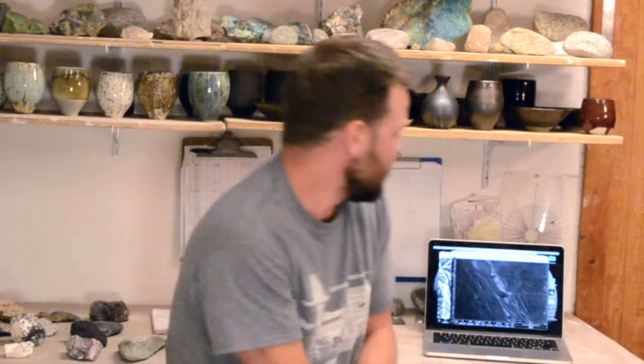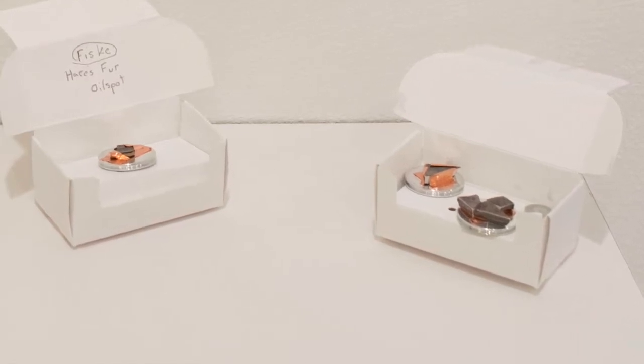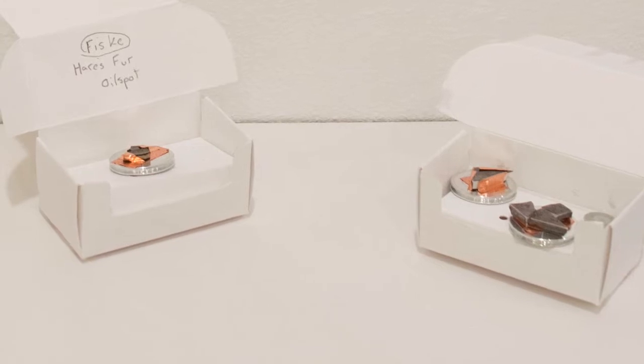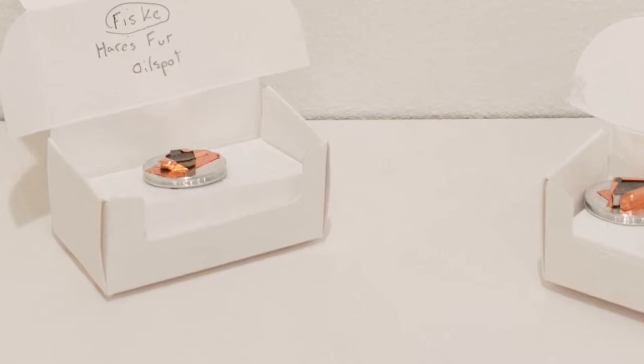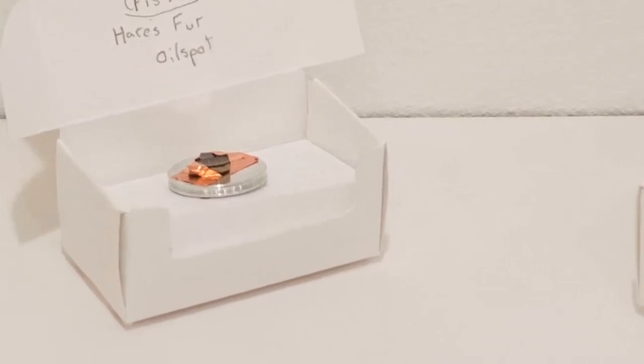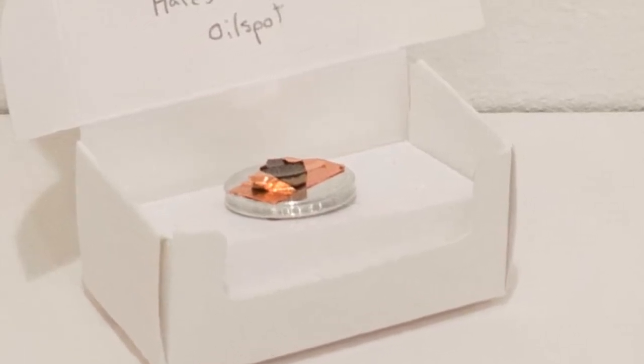With the samples that I was using, initially I had no idea what I was doing, and so I was just taking over broken chunks of glaze because we were really worried that having too much clay, and too much porous clay to be specific, inside of the vacuum chamber was going to cause problems with pressurization. But we just decided to try it anyway. And so one of the happy accidents of using those broken samples was that I was able to get some really fantastic cross sections of glazes.